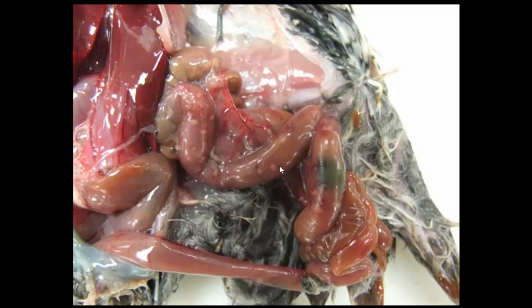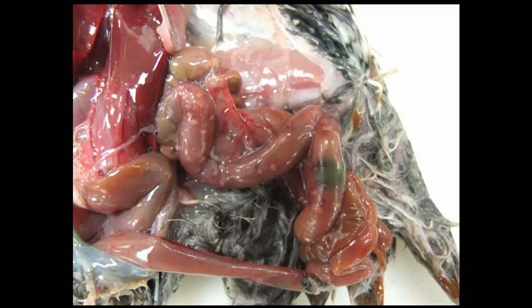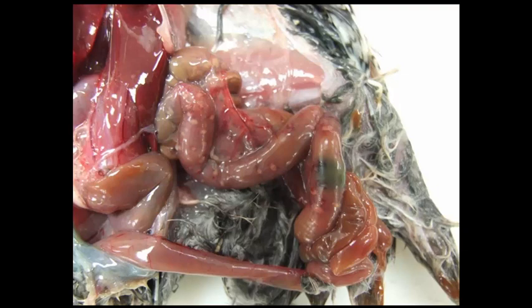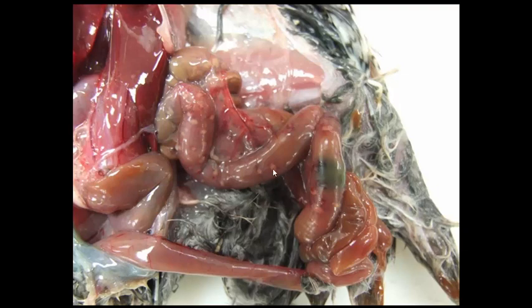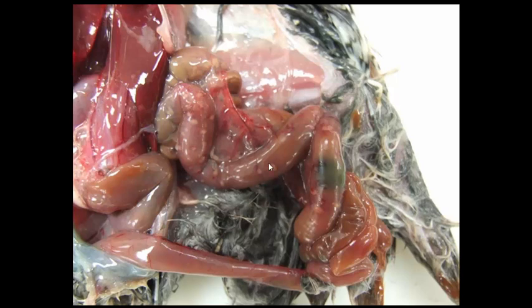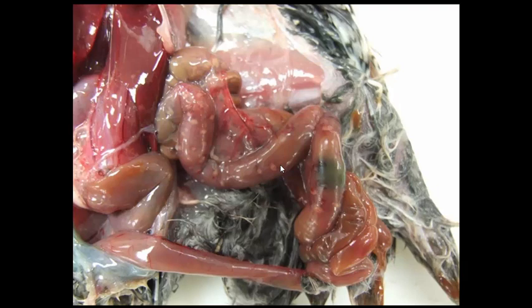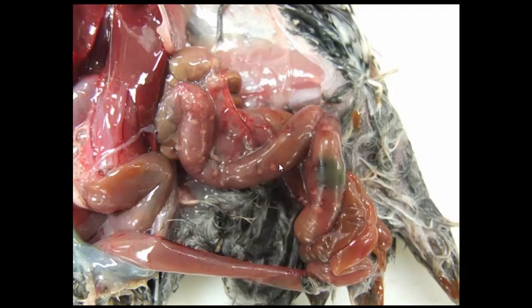This is a distinct Clostridium that affects bobwhite quail the worst, but it can be seen in a wide variety of birds including poultry, but does not affect waterfowl. It usually goes after younger animals between four to twelve weeks of age, but adults can be affected as well. This multifocal punctate enteritis with areas of necrosis with a hemorrhagic halo is very characteristic. You can also see areas of necrosis in the liver.